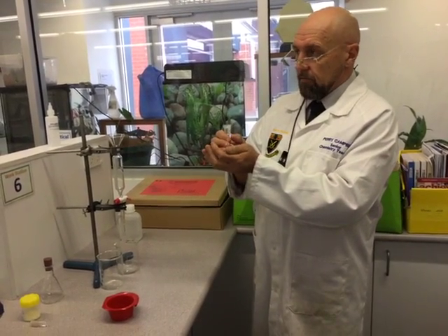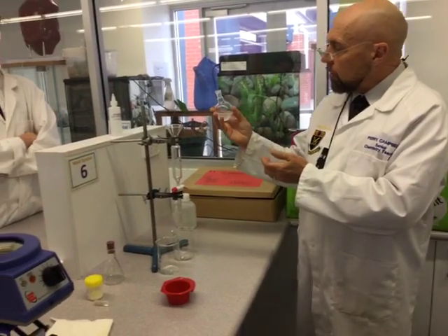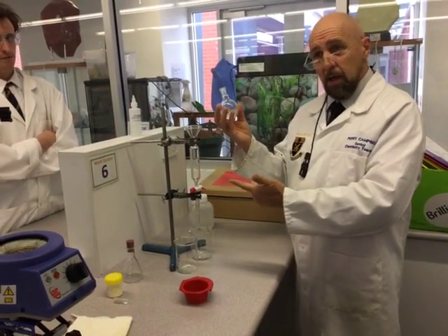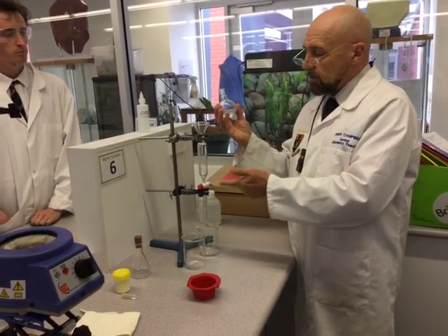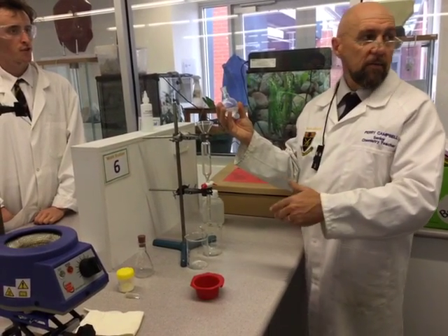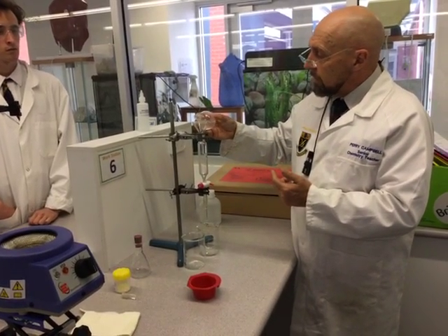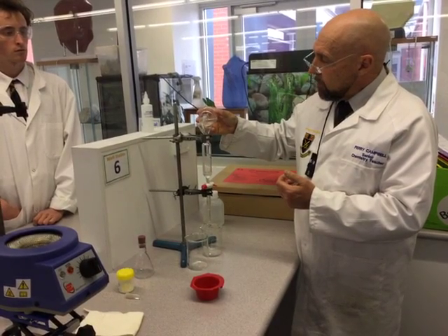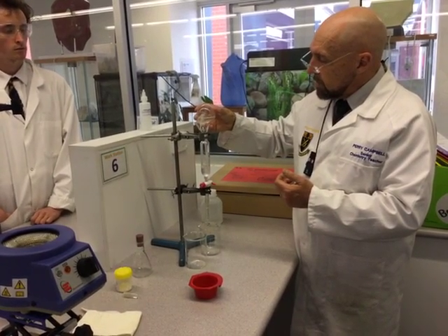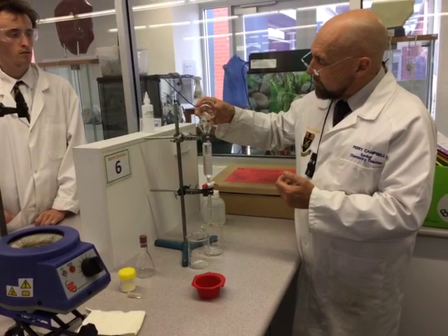So what I've done — it's sort of reasonably cooled down now — we're going to do the extraction. We know this is 50 mils and we've got a fairly large quantity of product here as well. So although the procedure says add 20 mils of water, it'll be whatever amount of water we can add. We're going to just cant that into here, and we want to try and avoid getting that boiling chip in. As you can see, it's going to be fairly full.